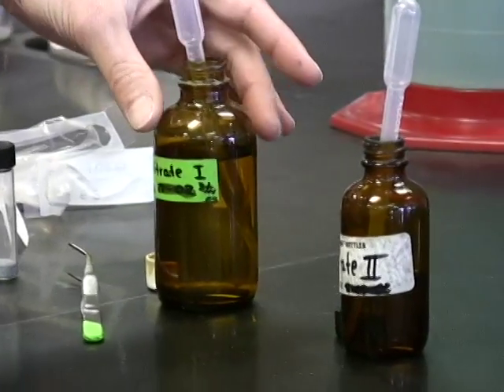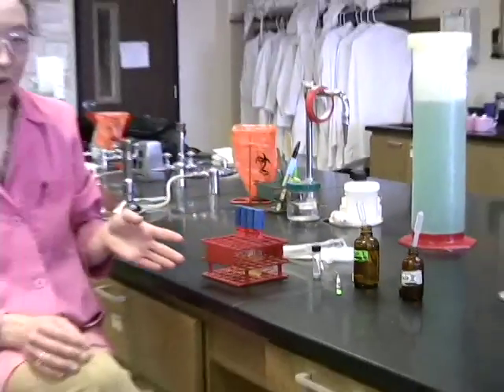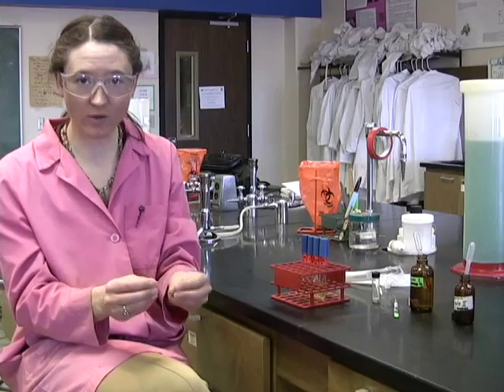Nitrate 1 and nitrate 2 will interact with the compound nitrite. If a bacterium converts nitrate into nitrite, that is, a reduction, then the nitrite will react with nitrate 1 and nitrate 2 and cause a red color change. So we're looking for that red color change after the addition of the two reagents. If we see it, we can immediately say that our test is positive.